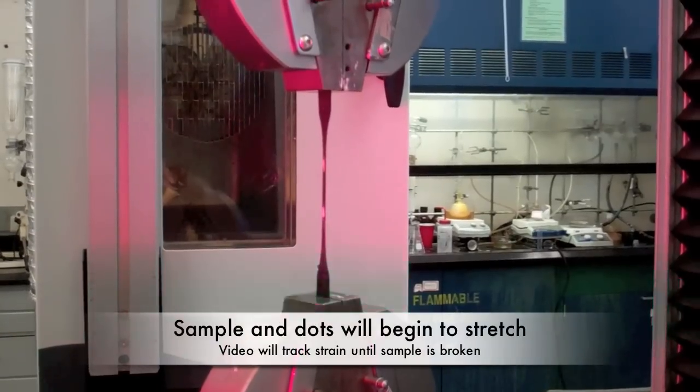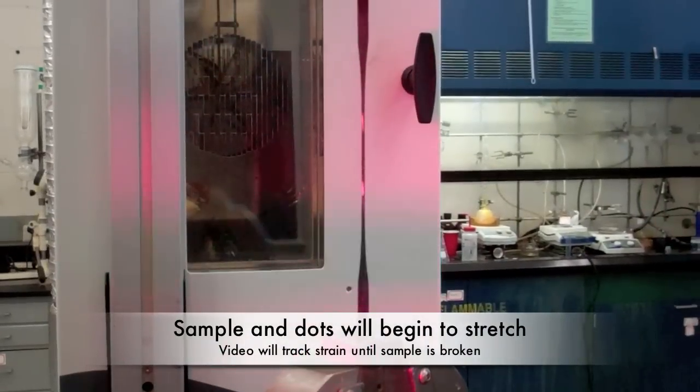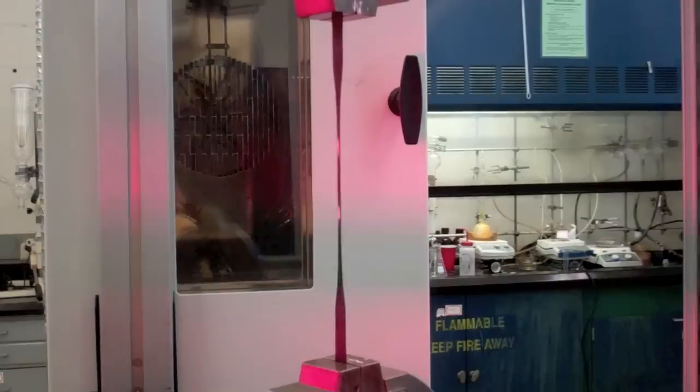The sample and dots will begin to stretch apart and the video extensometer is keeping track of the strain on the sample. The test is completed when the sample breaks.